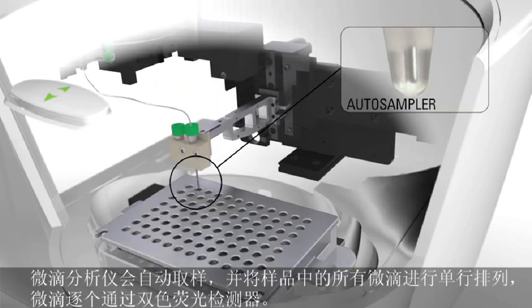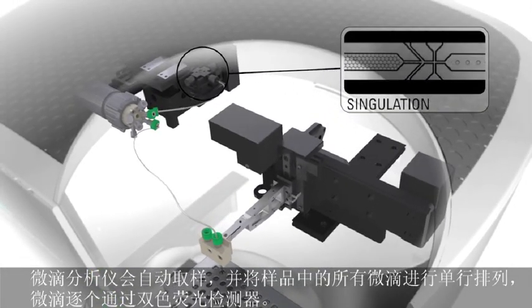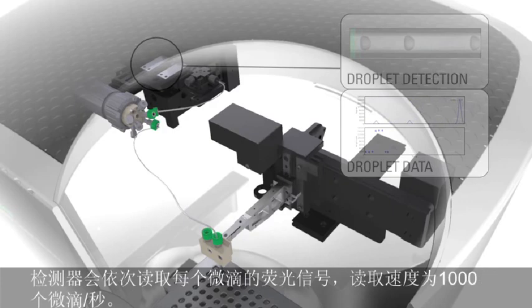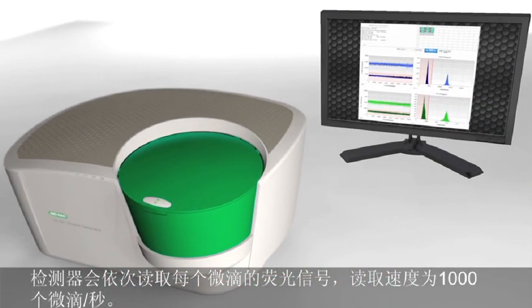The droplet reader automatically sips each sample, singulates all the droplets from a sample, and then streams them in a single file past a 2-color fluorescence detector. The detector reads each droplet in turn at the rate of 1,000 droplets per second and determines which droplets emit fluorescence and which do not.